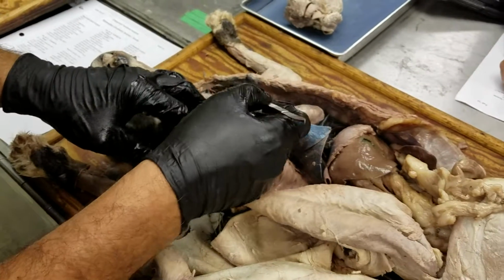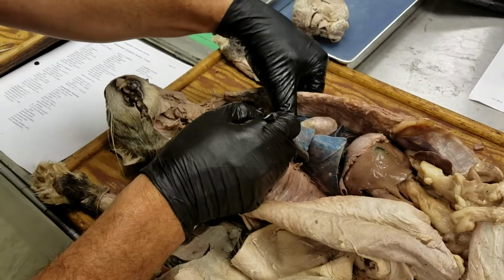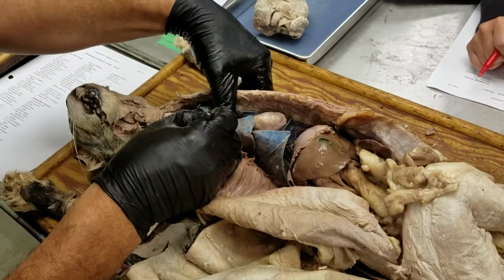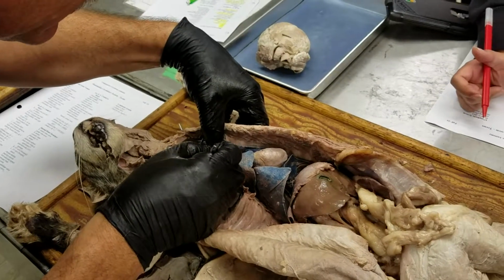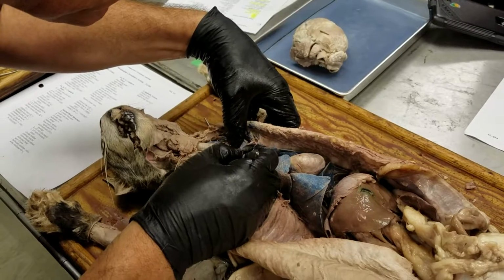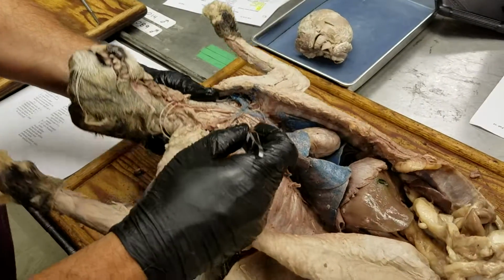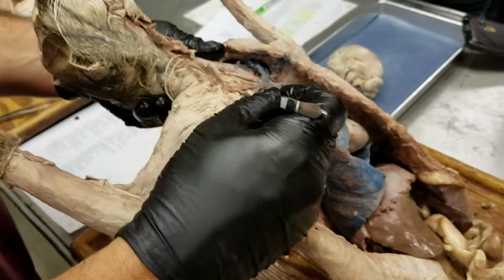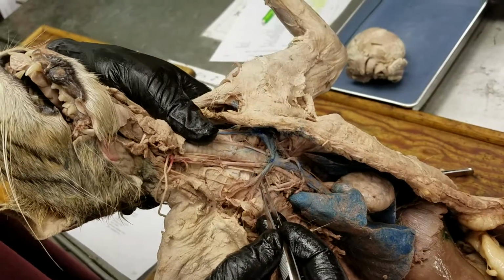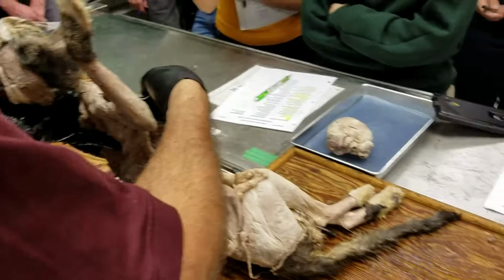Jasmine and I were just kind of working on this, and wasn't completely happy with this vessel, but I Oh, no, look at that. I know, like, where did it go now? I lost it. This one here, yeah. You see this branch coming off the subclavian that's diving in towards the vertebrae? I'm pretty sure that's the vertebral artery on this one. You see that?